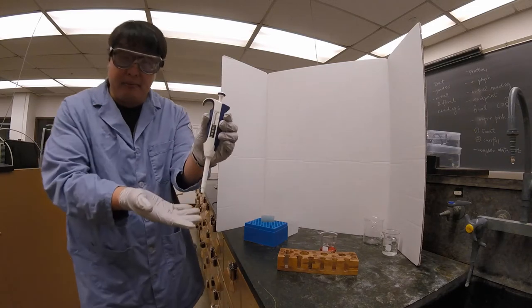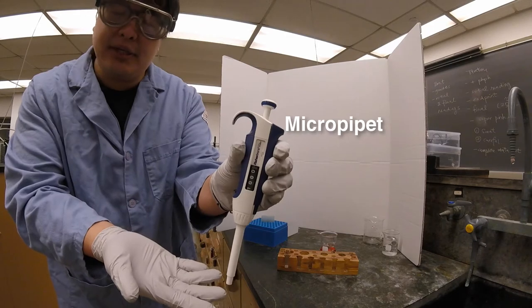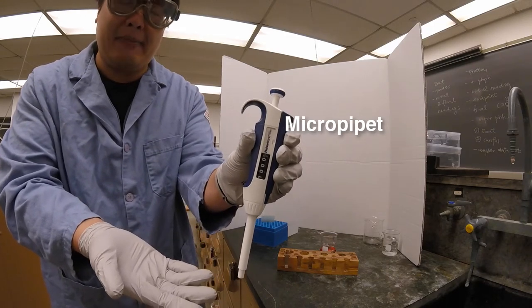This is a micropipette. As you can tell by its name, its function is very similar to a pipette.